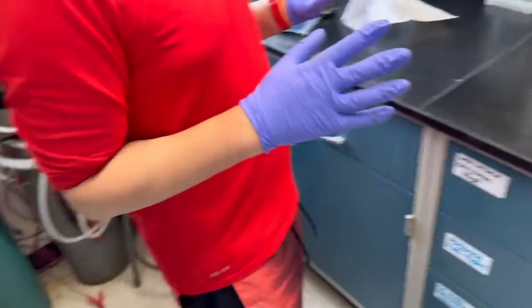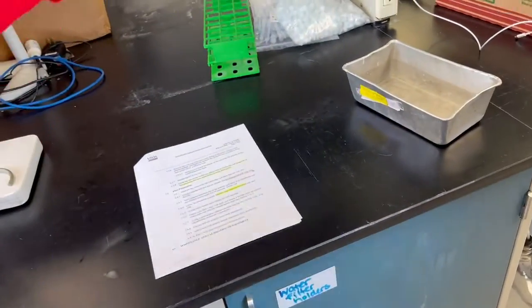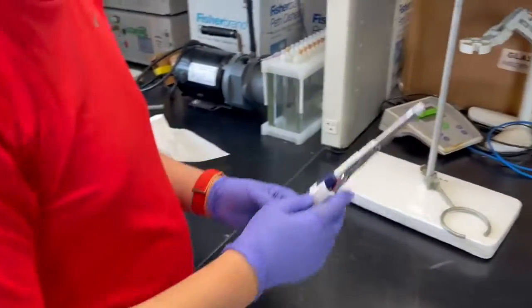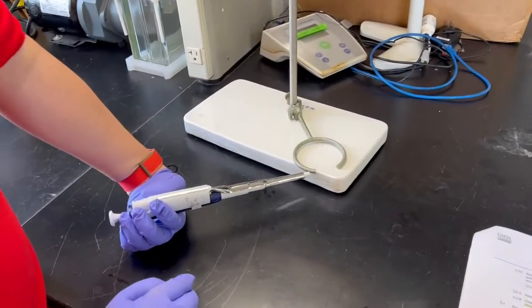So this time, where is the pipette? Oh, the one you want. So in this case, we have two. Yeah, we'll use this.